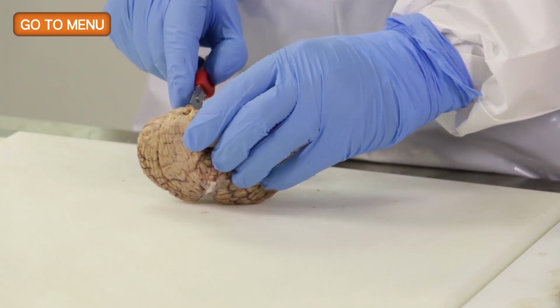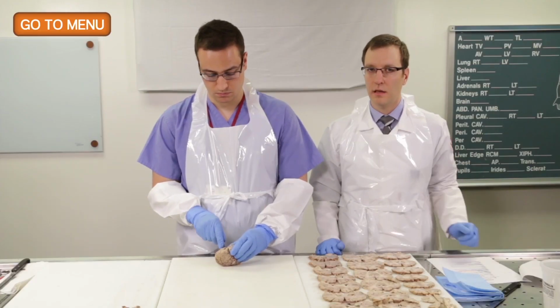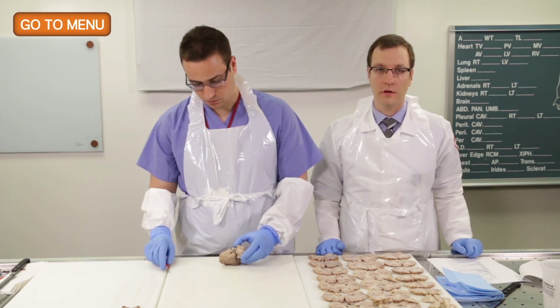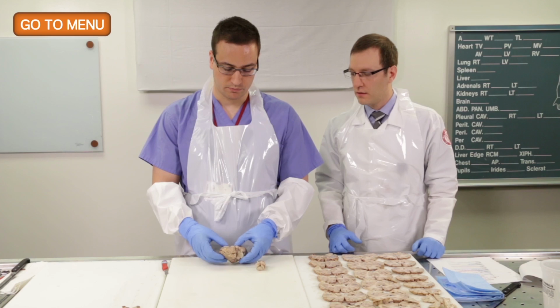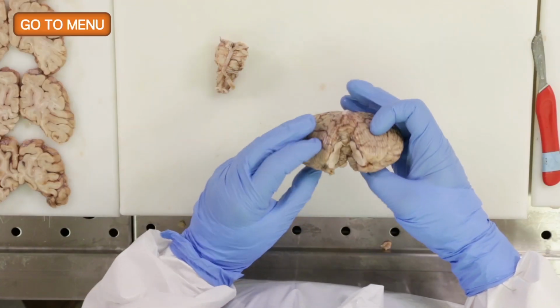And the purpose of separating the brainstem from the cerebellum is that we'll be cutting the cerebellum sagittally, but we'll be cutting the brainstem axially, which we do for adults. In pediatric cases, oftentimes it makes sense to keep the two together. So why don't you go ahead and cut the cerebellum, and then we'll cut the brainstem after. Sure.